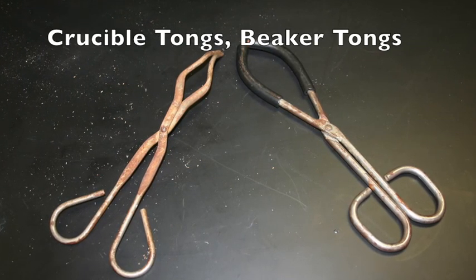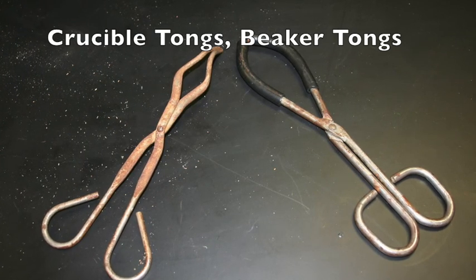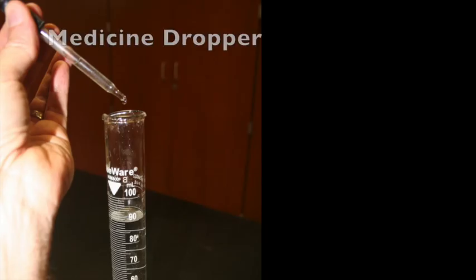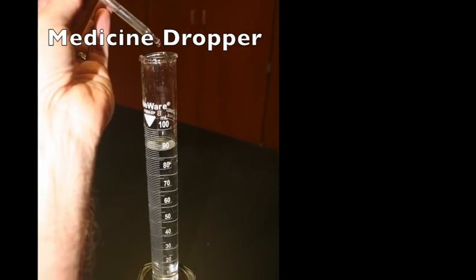The beaker tongs are designed to grab hold of a beaker so that it can be safely moved when it is too hot to handle. The medicine dropper is used to transfer liquids one drop at a time.